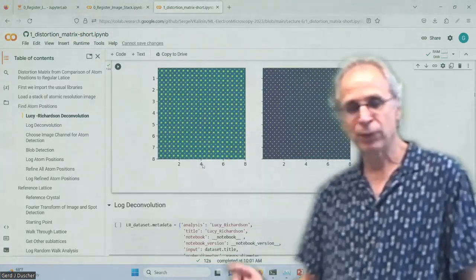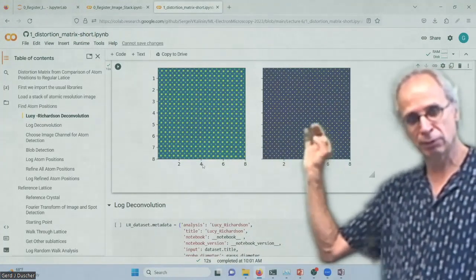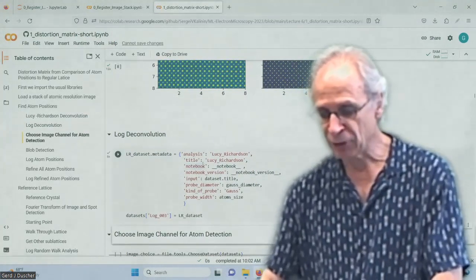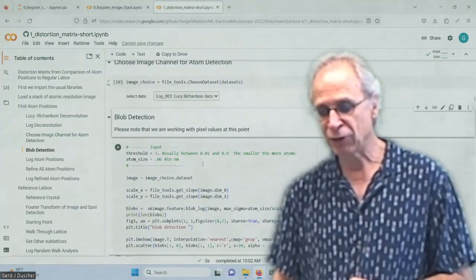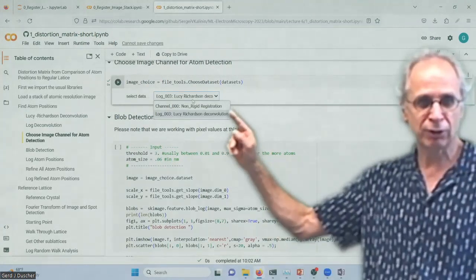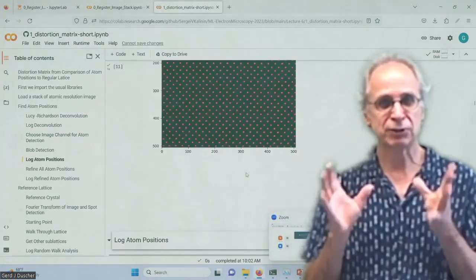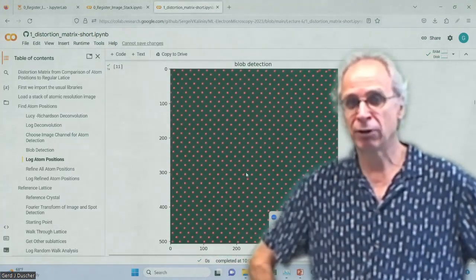Whatever. So instead of these really big atoms, we now get very, very small blobs. And we save that Lucy-Richardson deconvolution. And we can now, in the image choice, determine that we want to have the Lucy-Richardson deconvolution for our blob finding. And obviously, this is very, very fast. Push here. And it's very reliable.